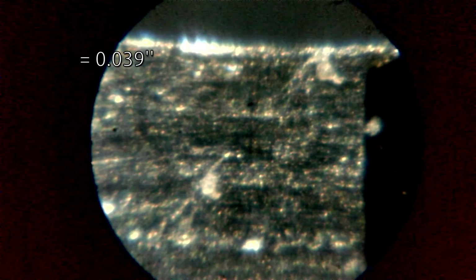This is a steel rule. There is nothing exciting visible here, but the view tells me that the diameter of the viewing area is a bit less than 1 mm.